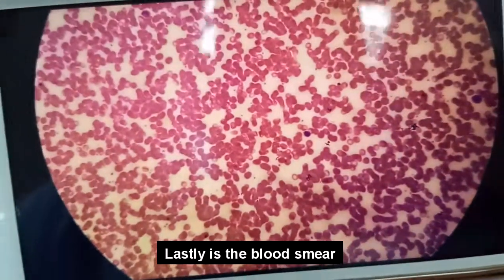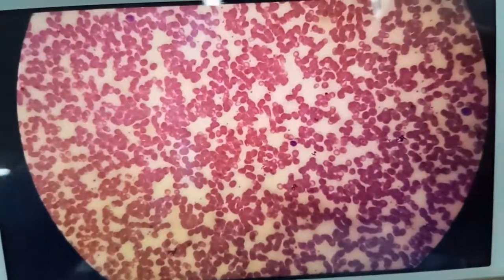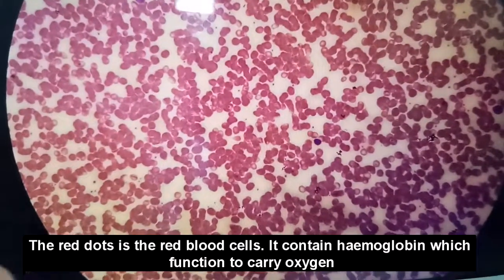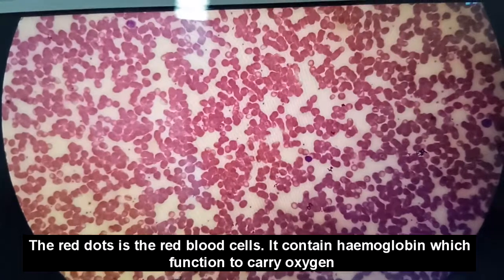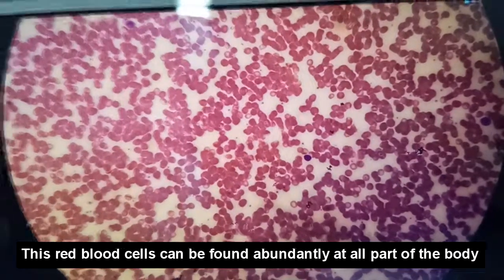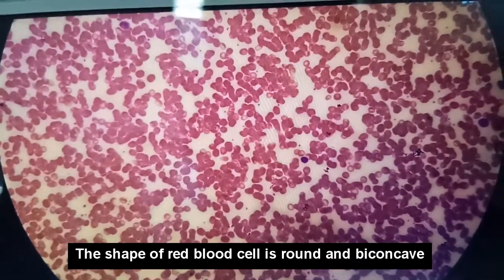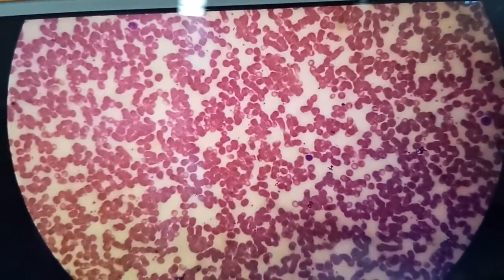And lastly is the blood smear. So as you can see, there are a lot of dots of reddish color. The red dots are the red blood cells. They contain hemoglobin, which functions to carry oxygen. Red blood cells can be found abundantly in all parts of the body, and the shape of the red blood cell is round and biconcave.